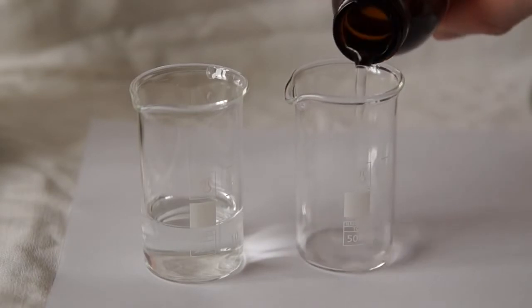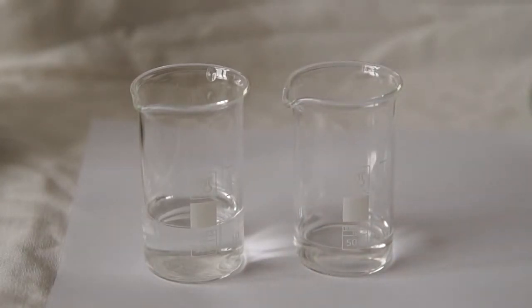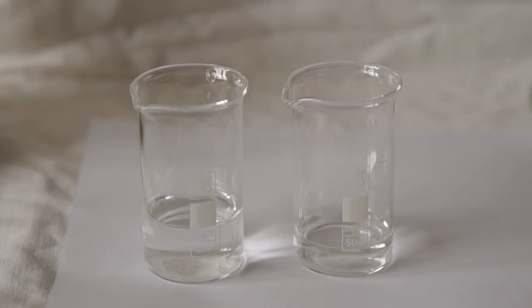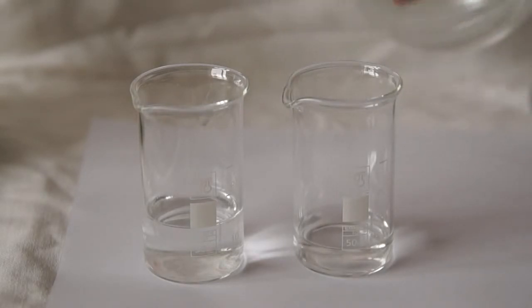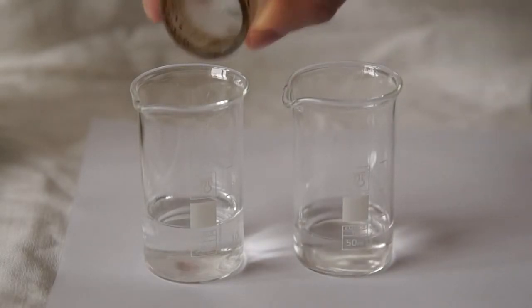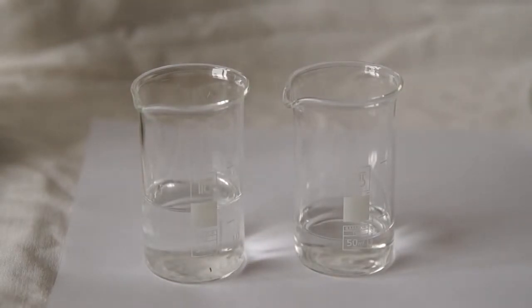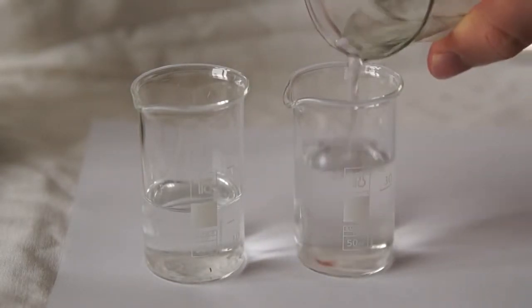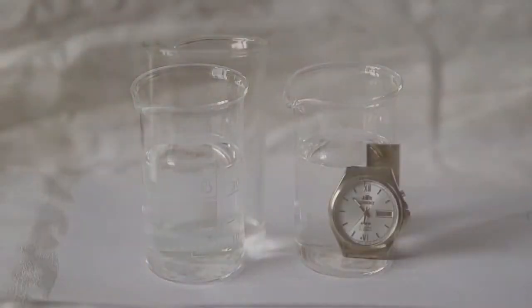That solution may be of various concentrations. For this purpose, I pour into each beaker a different amount of 30% hydrogen peroxide. The solution was acidified and the acid solution was diluted to 40 milliliters.